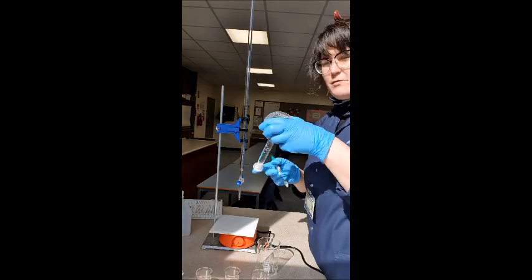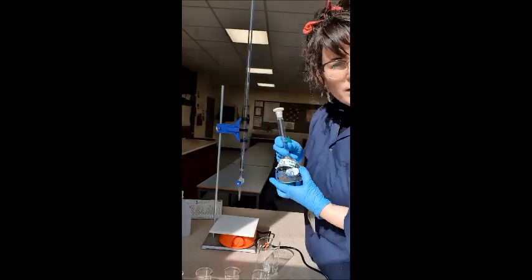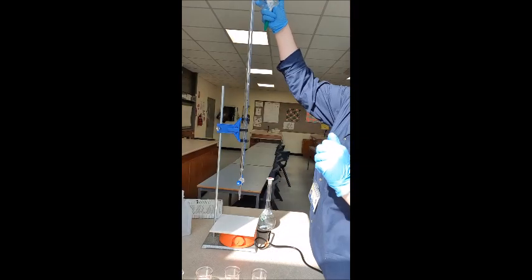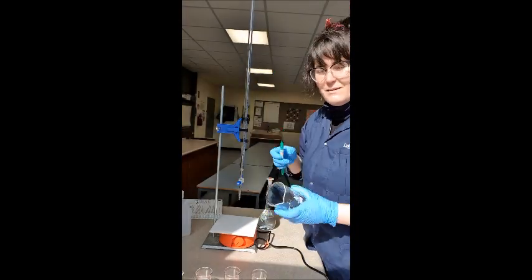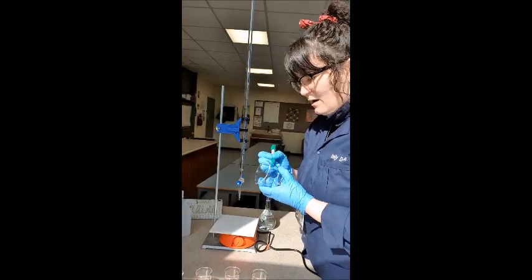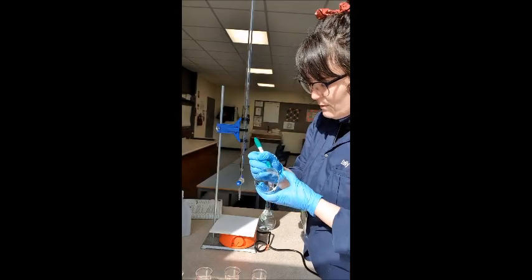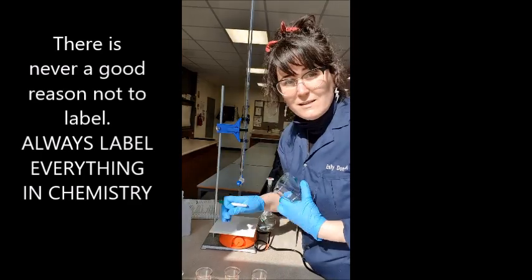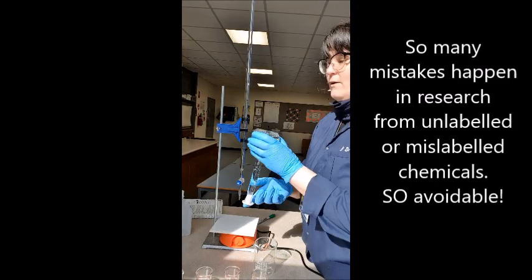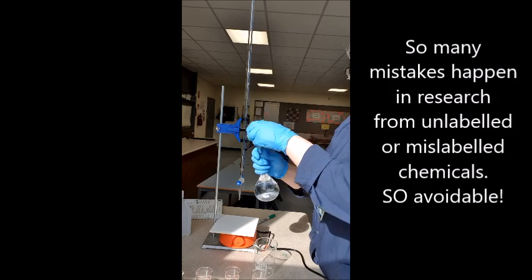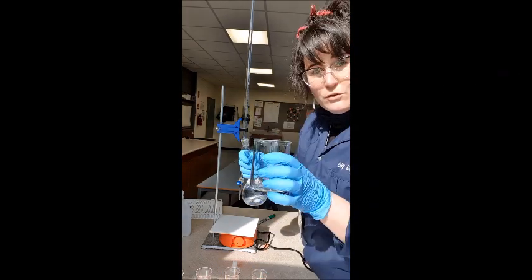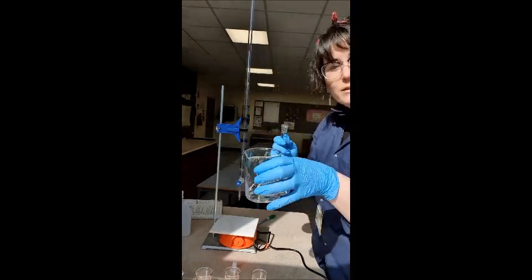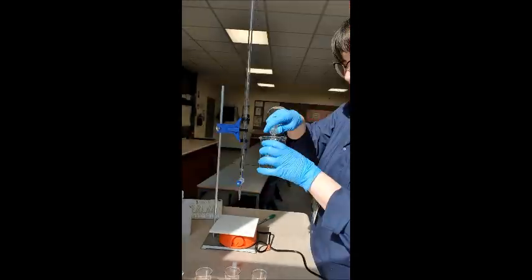I'm just going to put them aside and I'm going to fill up my burette. So instead of filling it up straight from this flask in here, it can be a bit tricky. So I'm going to pour it into a beaker and then use the beaker spout to pour it in here. If you were doing this, you would use a funnel up the top. But because I've been doing titrations for decades, I've got good pouring skills, so I don't need a funnel. But I'm labeling this as sodium carbonate. Now again, before we fill it, give it another mix. And because I'm going to use this for the whole time to fill up sodium carbonate, I just want to give it a rinse with the sodium carbonate. So remember analytical chemistry, we rinse all of the glassware with the thing that we're using, we're going to use it with.